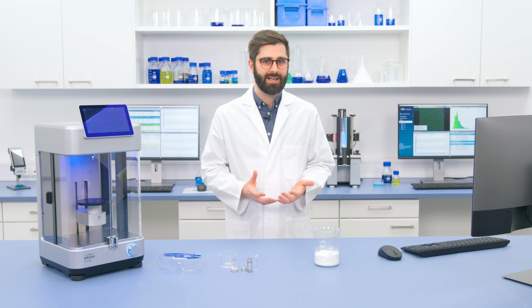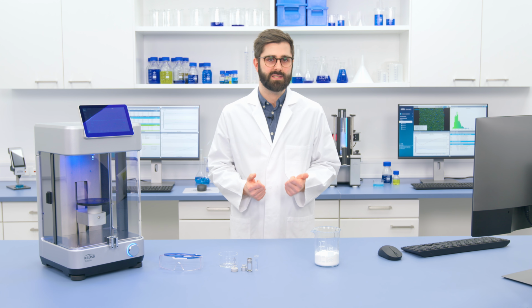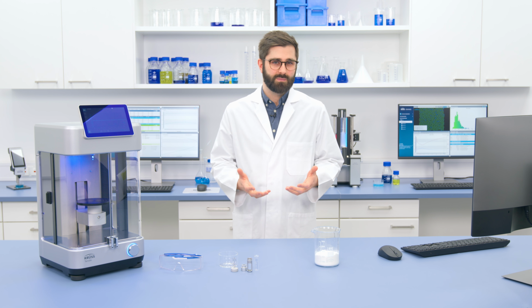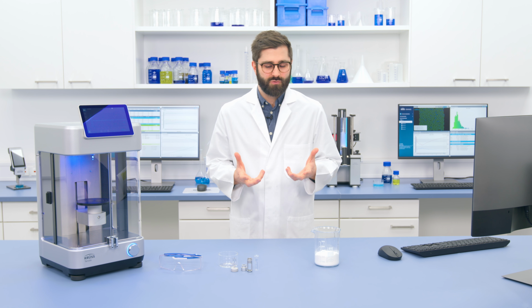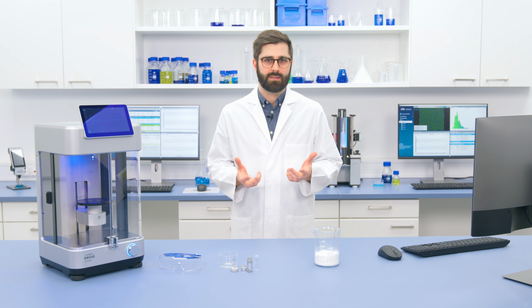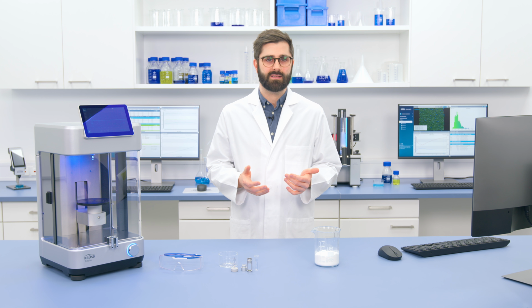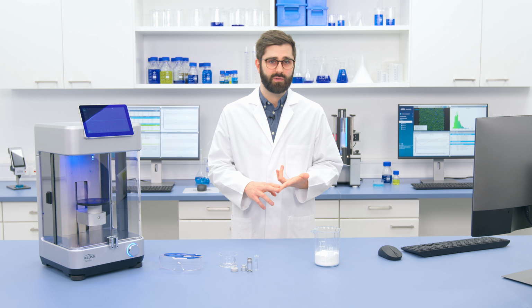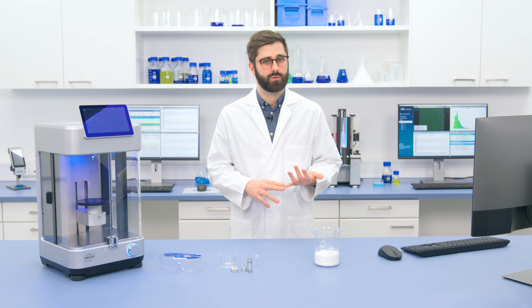Now, contact angle analysis is a very useful tool for assessing material wettability or surface activation, but sometimes we come across samples that are particularly tricky to measure. This is most obvious when we're dealing with things like powders, but it can also include all kinds of porous materials like textiles and fibers, membranes, or even rocks or soil samples.